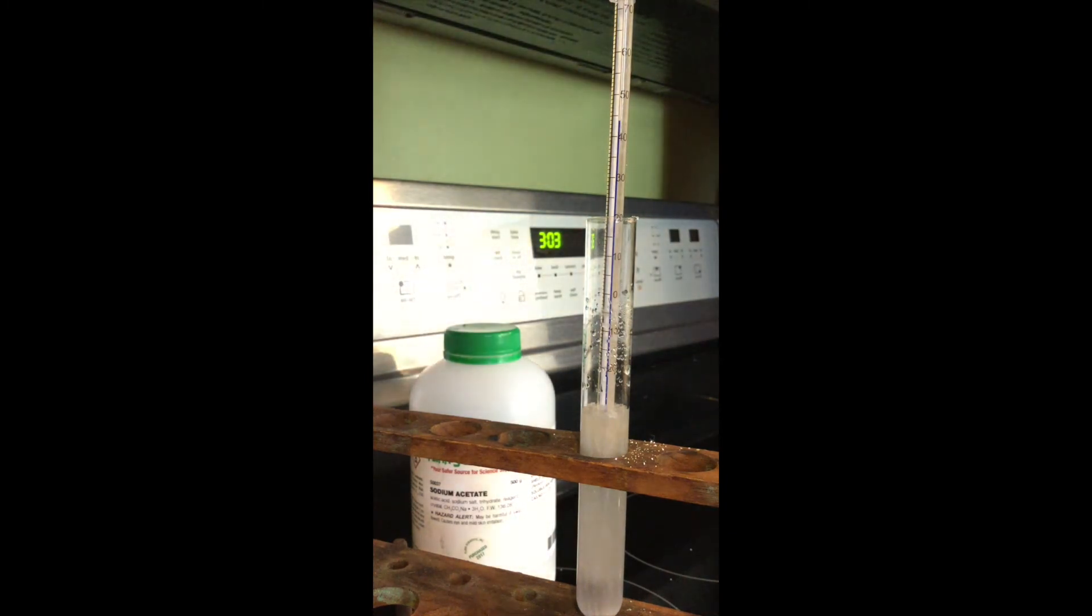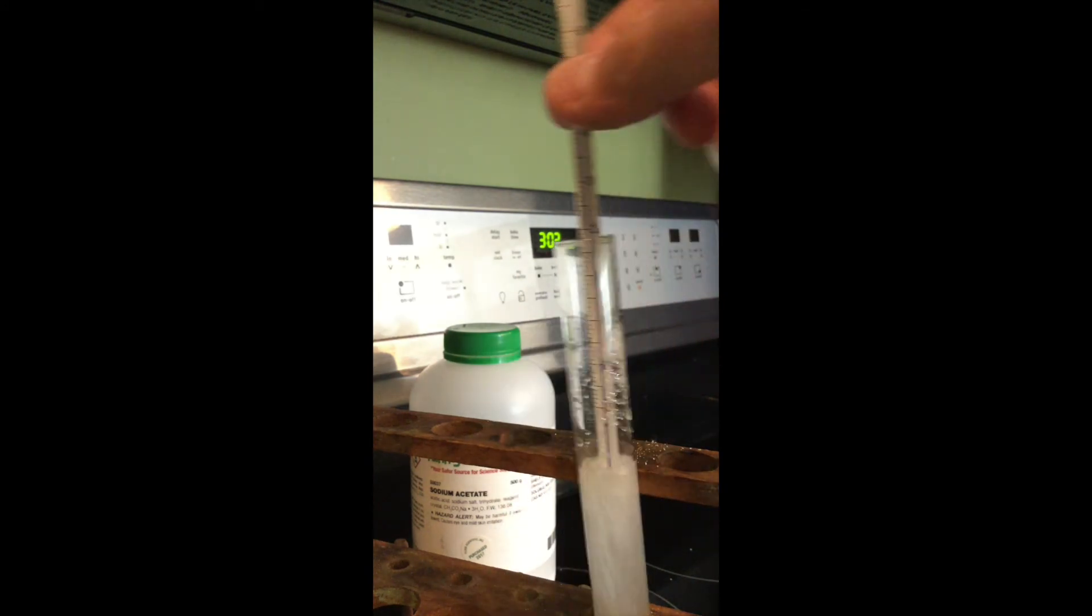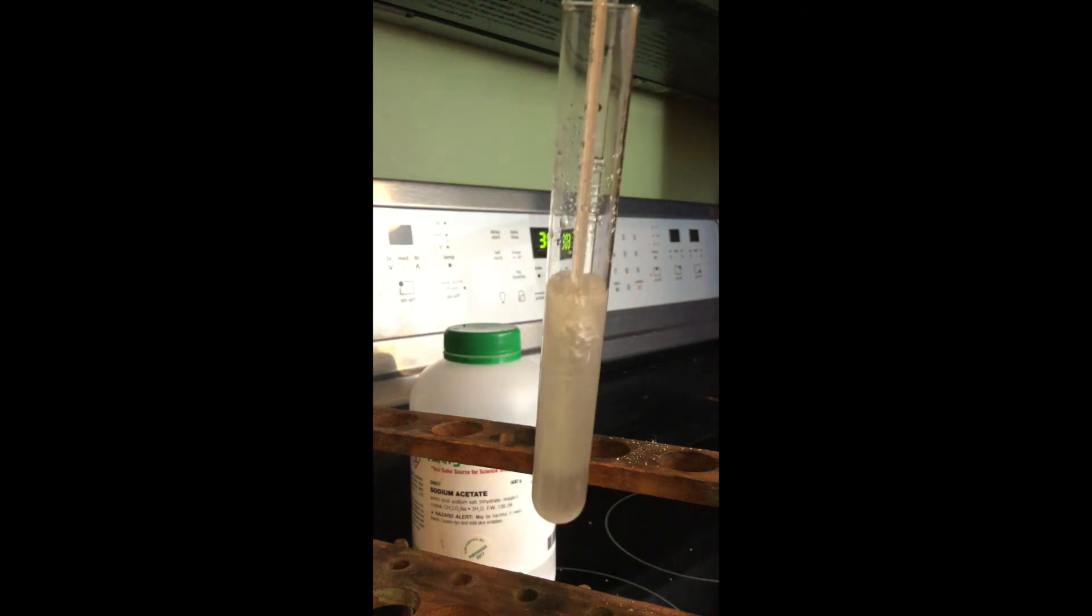And people always want to know, hey, did that really turn into a solid? Sure did. Take a look. Thermometer's stuck in there. In fact, I've had students break them off trying to get them out. You better heat this solution back up and turn it into a supersaturated solution if you'd like your thermometer back.